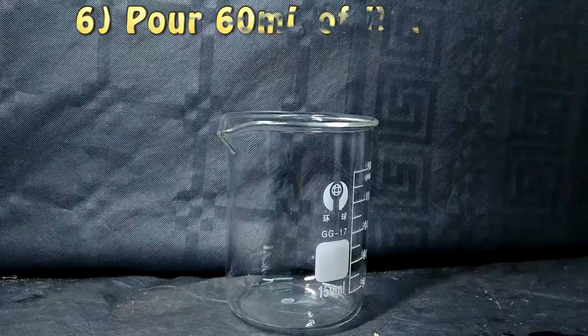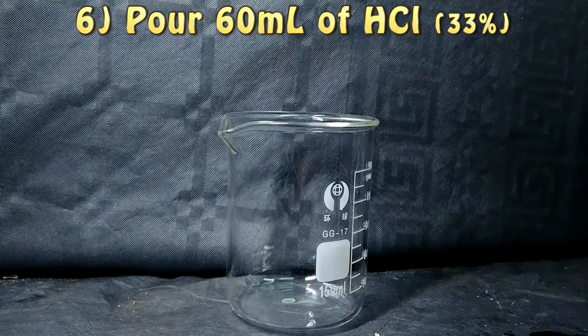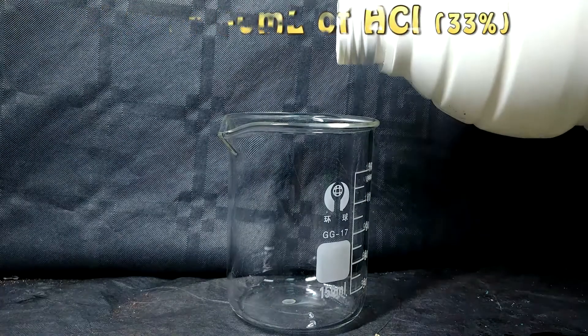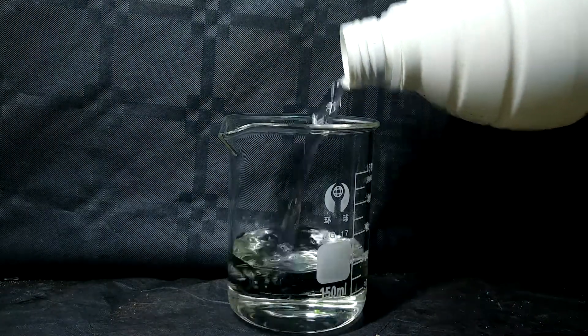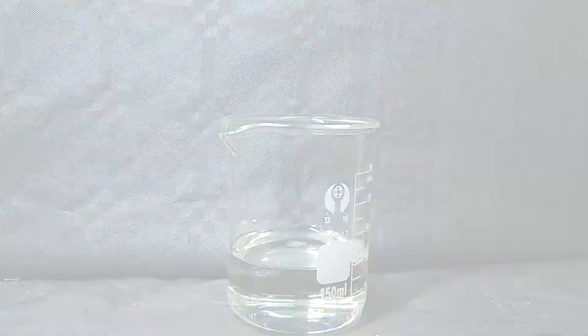The next part of our experiment is to pour 60 milliliters of hydrochloric acid into this. We are going to mix the two solutions in another container and let them rest for a bit. Then we are going to transfer everything into a conical flask.